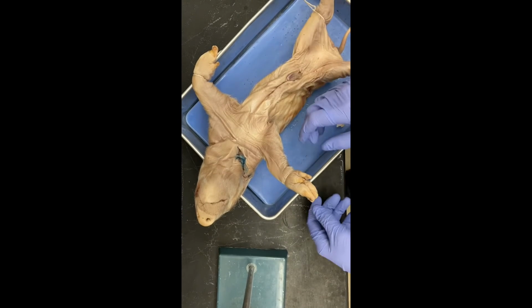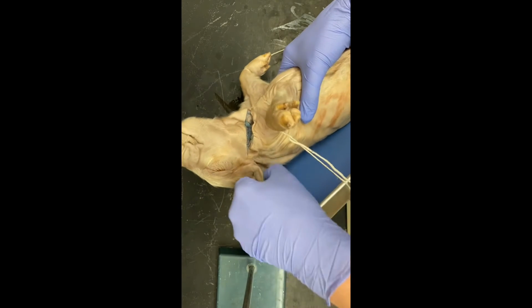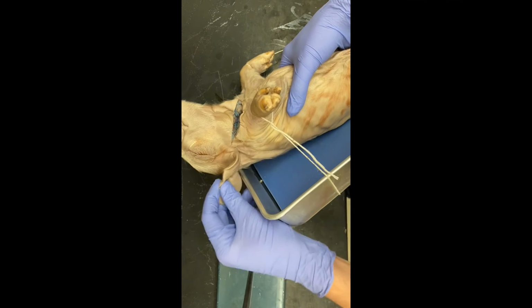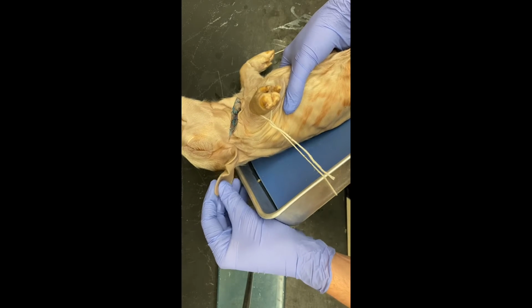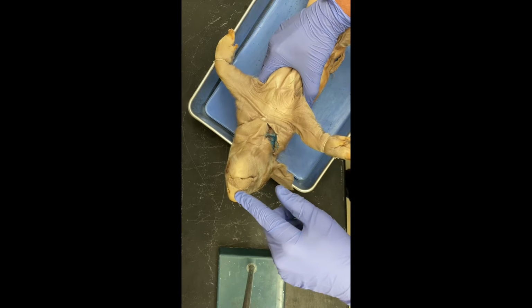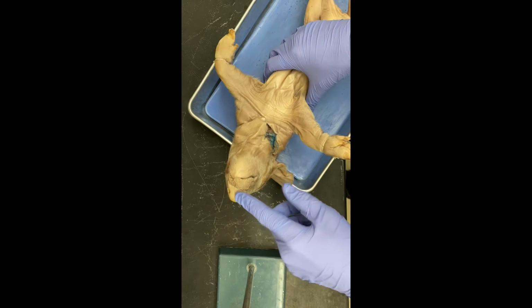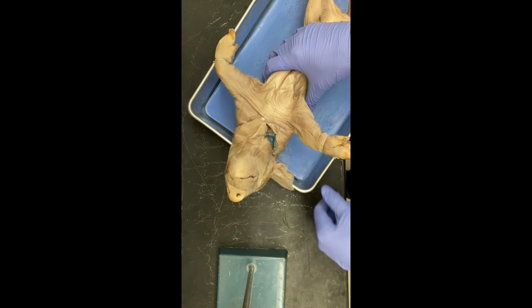Alright, we're going to start off with the external anatomy of the pig. First, right here, what you would call the ear. The outer bit of the ear is called the pinna, and it directs sound into the middle ear. The external nares of the pig are right here, and they're the holes, and they allow for a sense of smell along with being able to breathe through their nose.